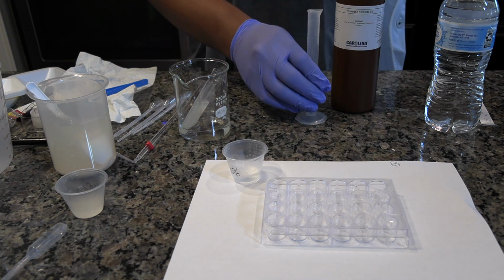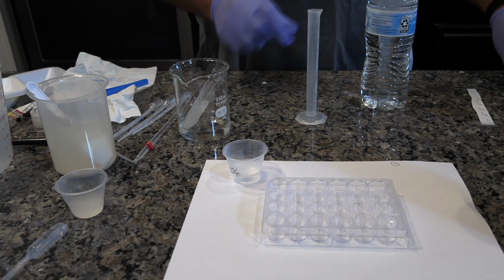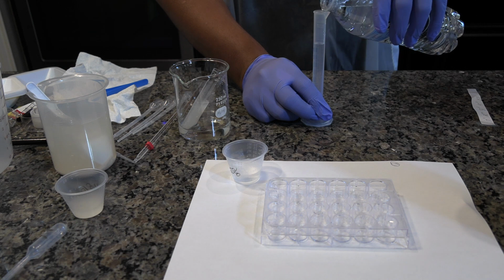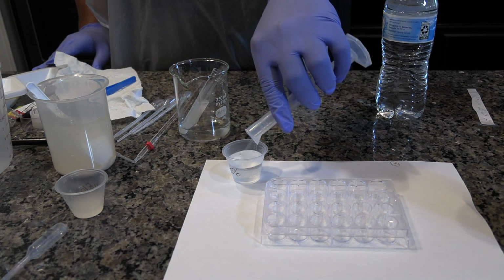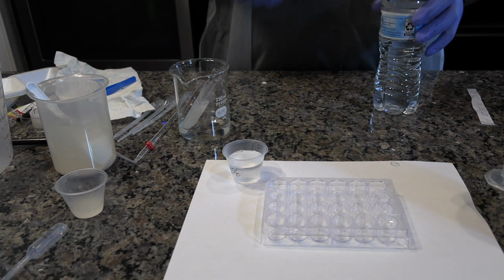Each well comes labeled from the factory with a letter and number to the upper left of the well. Orient the well so that A1 is in the upper left corner. The wells will be referred to by column and row number.